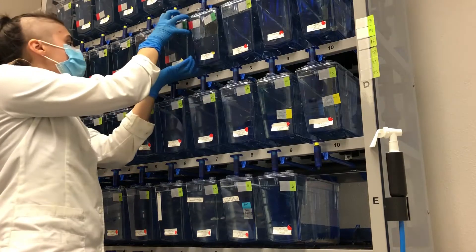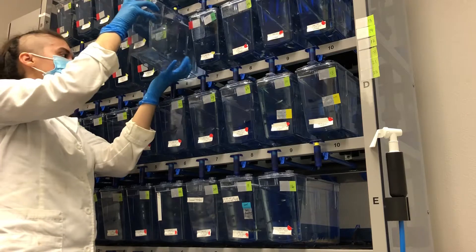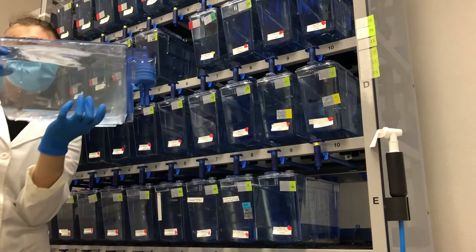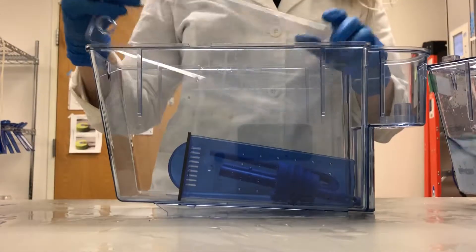At our facility tanks get cleaned about once every five or six weeks. Here we'll go through the steps that we take when cleaning a single tank.